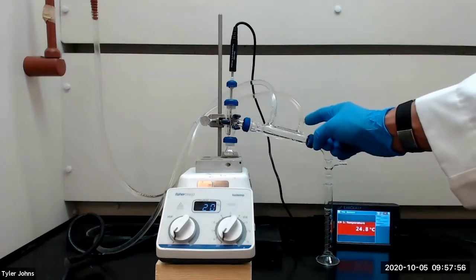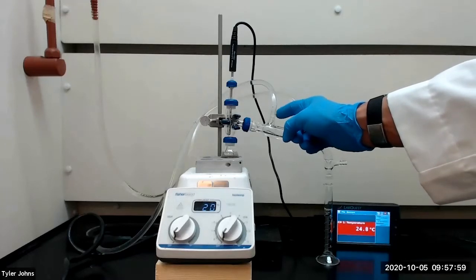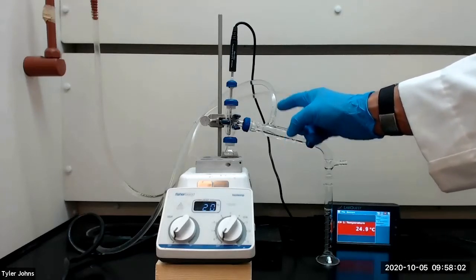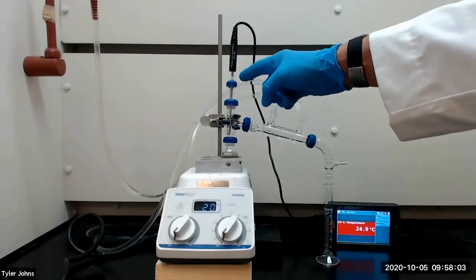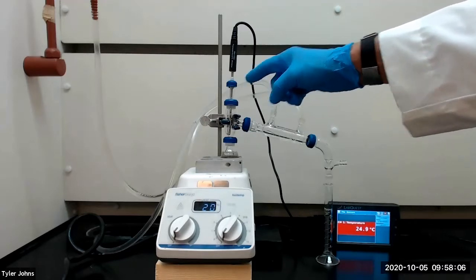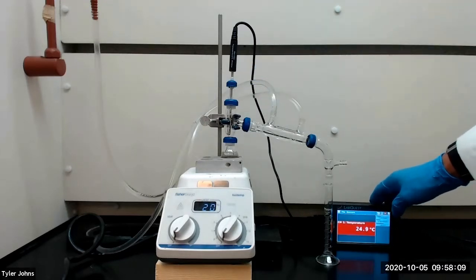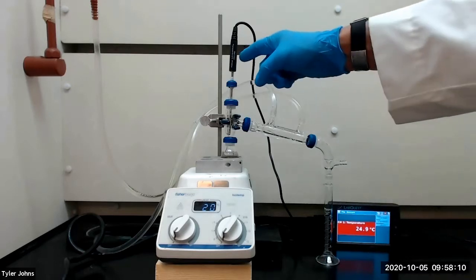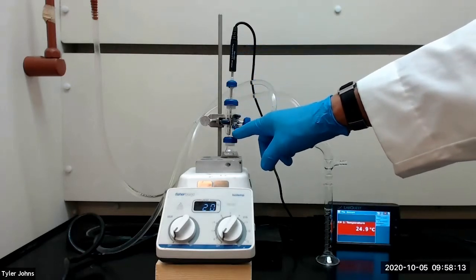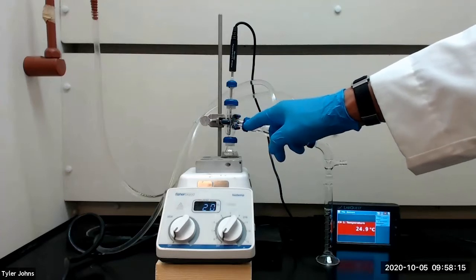The water enters our water-cooled condenser here and exits here. We've inserted a Vernier temperature probe into our simple distillation apparatus and we will monitor the temperature of our distillation with the Vernier temperature probe. Note that the probe extends below the side arm of the connecting adapter.